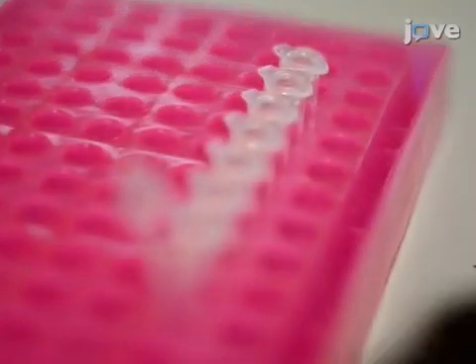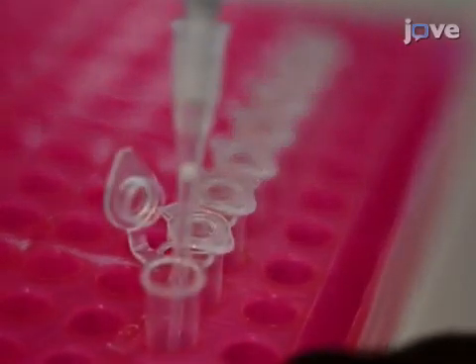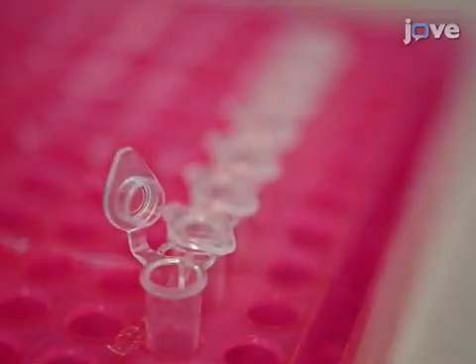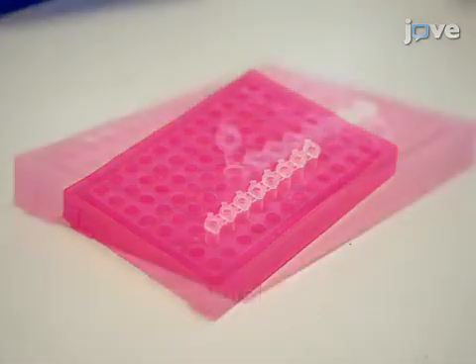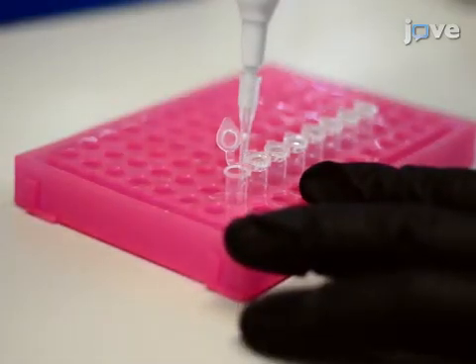Similarly, denature 3.3 microliters of the template of interest with 3.3 microliters of denaturation buffer. Incubate at room temperature for 3 minutes. Quench with 3.3 microliters of neutralization buffer.